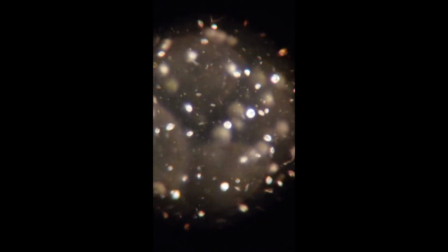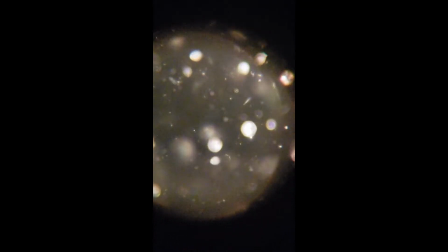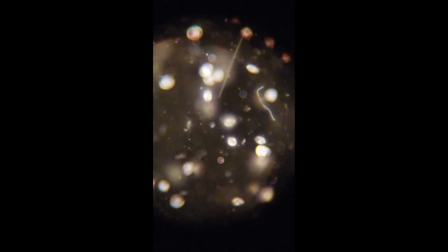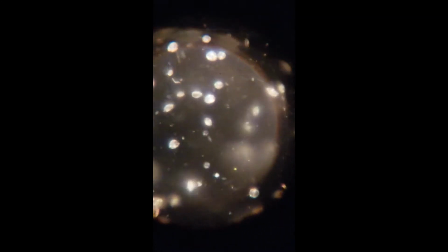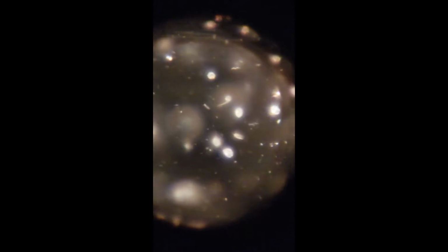I'll take a look just a little bit closer. There we go. Now they are in water, which means they're swimming up and down, and so it is difficult to get anything in focus. They are alive, that's for sure. Oop, there's a long stick-shaped something. It's moving down the screen. You can see how they swim up and down in the water. Makes it difficult to get them in the same focus.